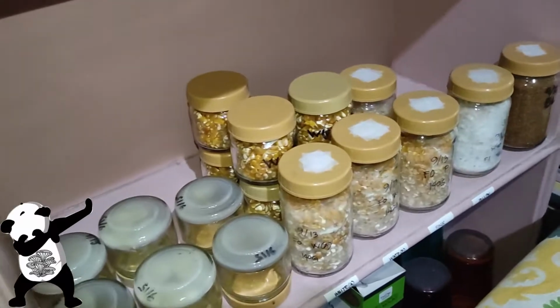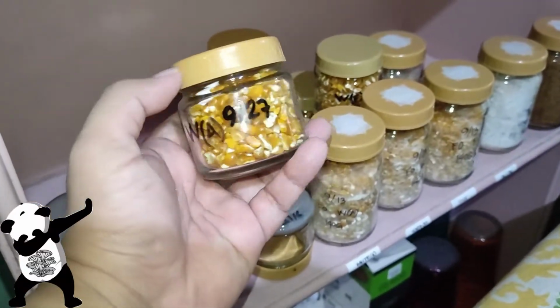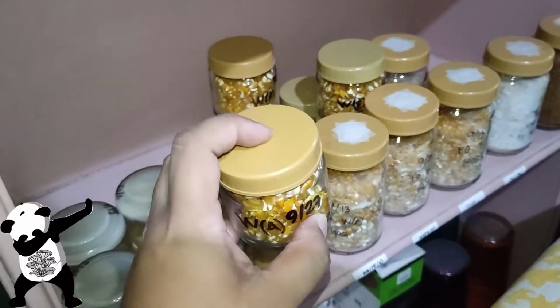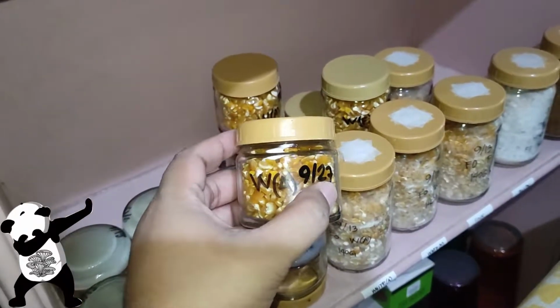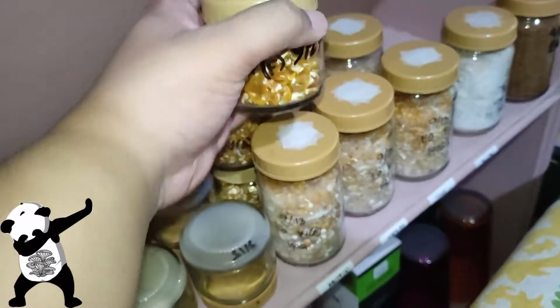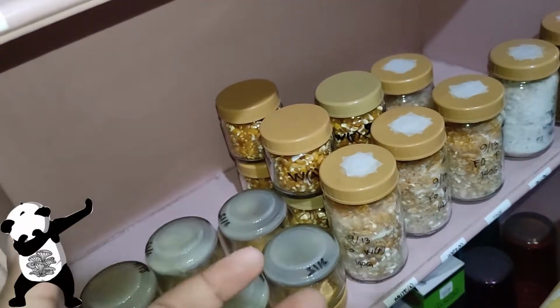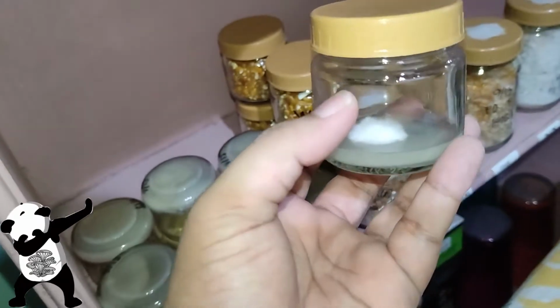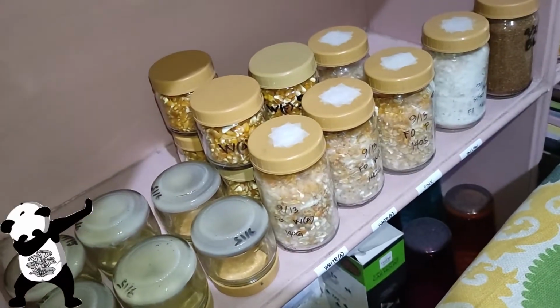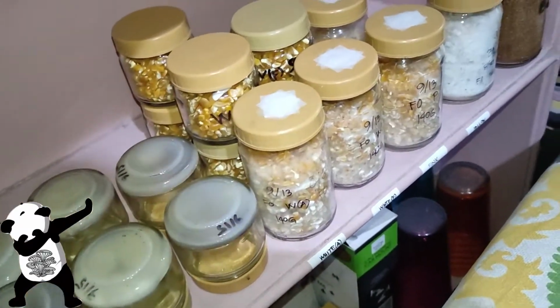Hello, good morning. Today is September 28th, and as part of our recent experiment, I did a direct tissue transfer on these grains yesterday, so it doesn't have any opening. I'm not sure if it's going to work fine. The idea is, since it's small, it might have enough time to colonize the grains, but I know it is not like the PDA, which is 2D, and this was inoculated on September 24. It's an experiment, and I know that most of my experiments fail, so I'm up for that.